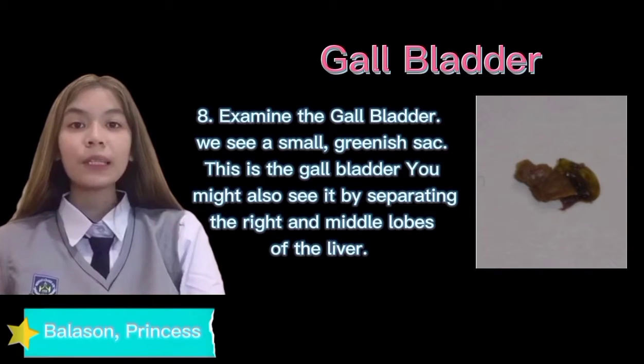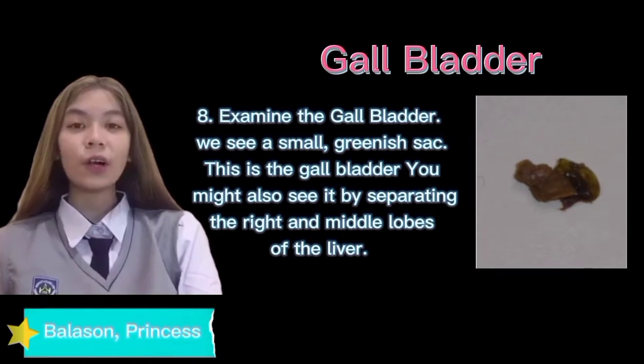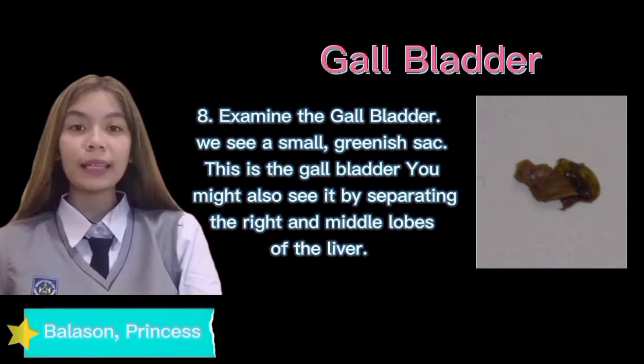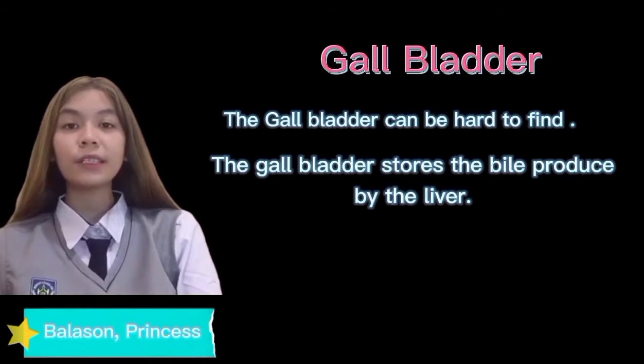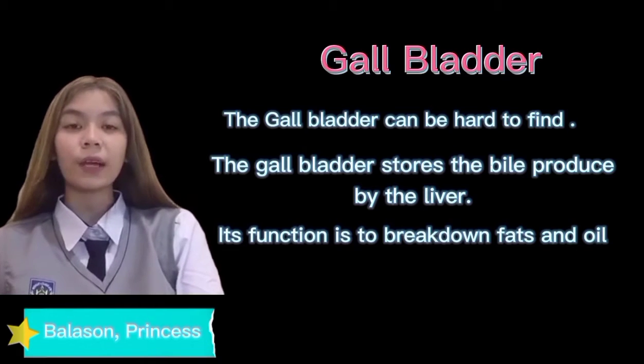Gallbladder. Examine the gallbladder. Under the liver, we see a small greenish sac. This is what you call the gallbladder. You might also see it by separating the right and middle lobes of the liver. The gallbladder can be hard to find. The gallbladder stores the bile produced by the liver, and its function is to break down fats and oils.